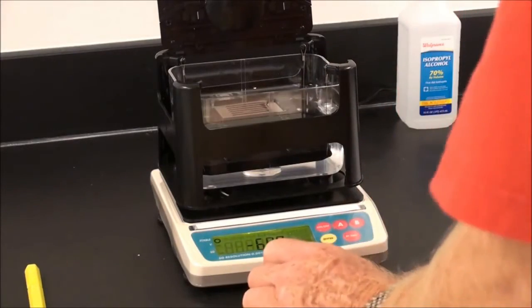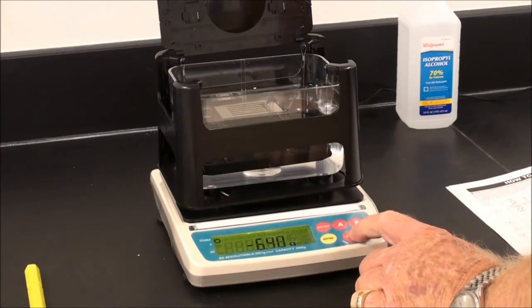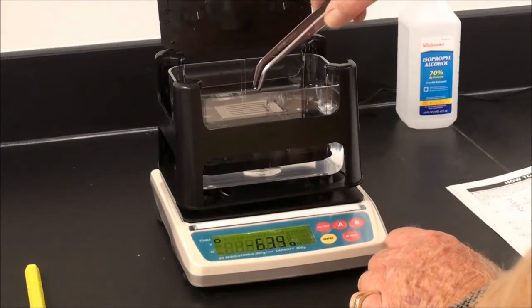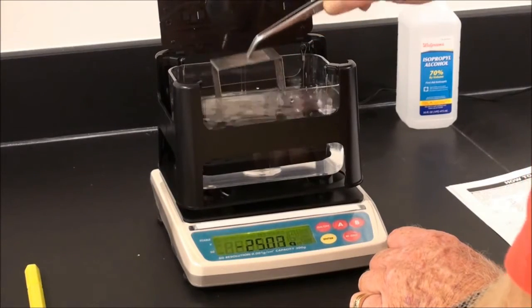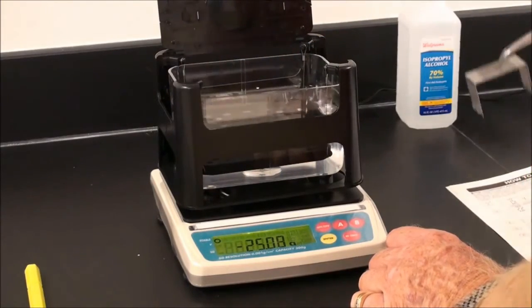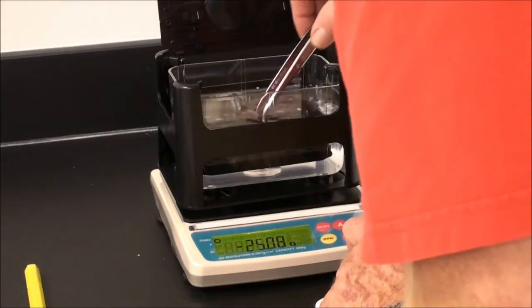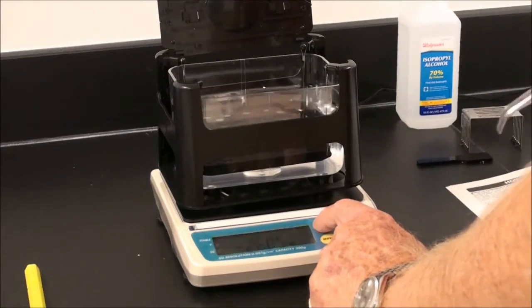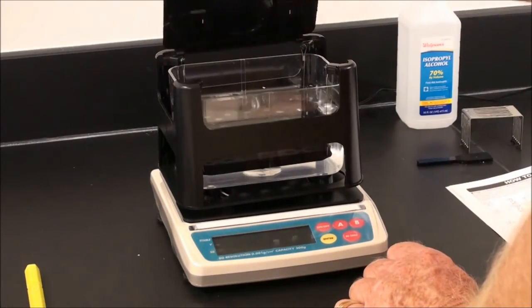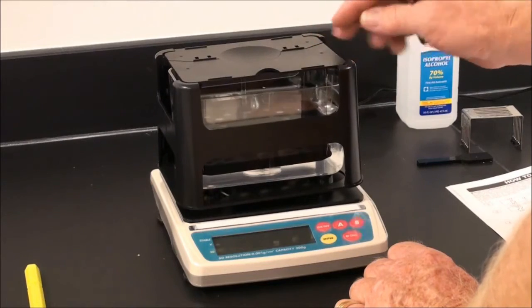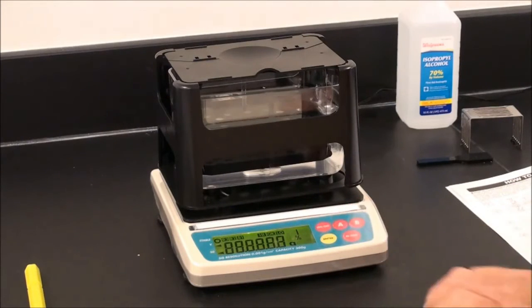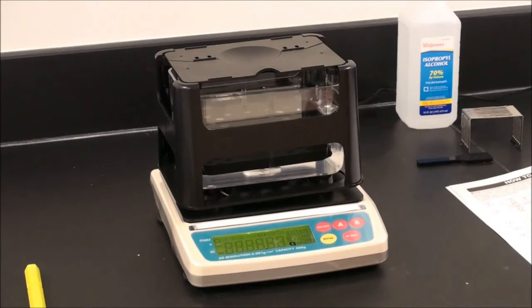Now we are ready to restart again and re-zero the system. At any time, if you need to re-zero the system without the compensated weight, simply turn the power off. Close the lid, allow all vibration to cease, turn it back on, wait for stabilization mark. And now we're ready to go.